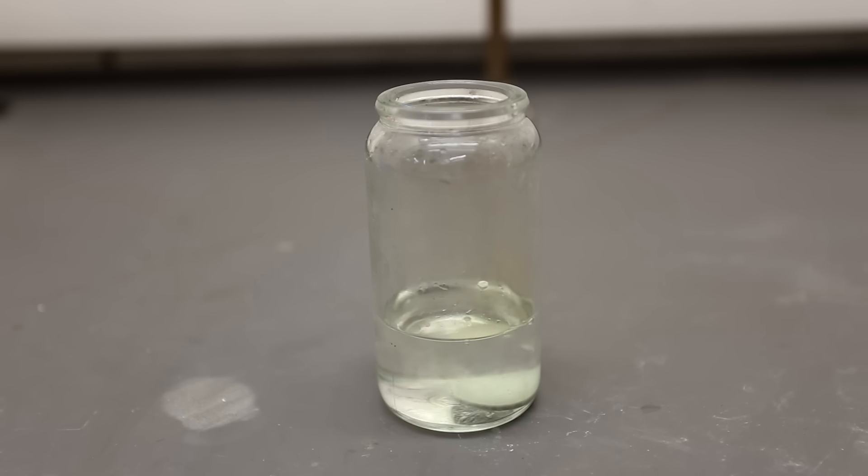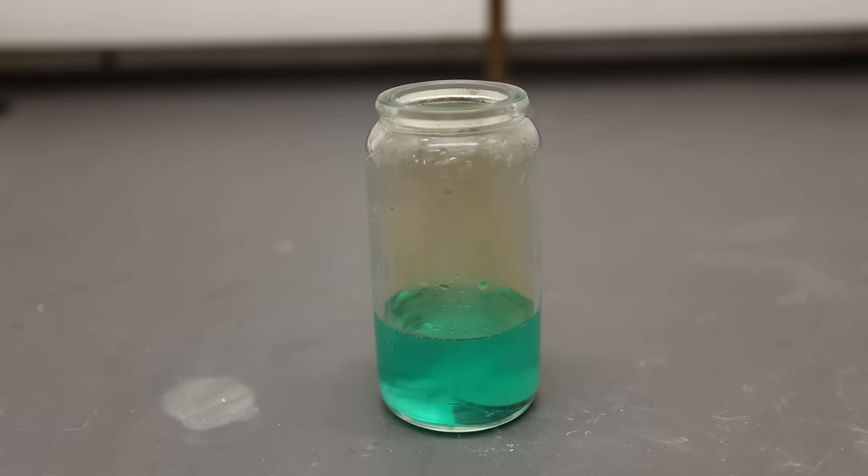Next I added a silver quarter to the nitric acid. The nitric acid used here is in severe excess — I used the amount I did for visual effect, but it should be good for at least two quarters or multiple coins. Also, the purpose of diluting the acid is so that the reaction with the quarter is not violent.